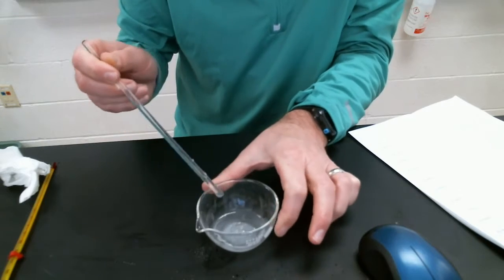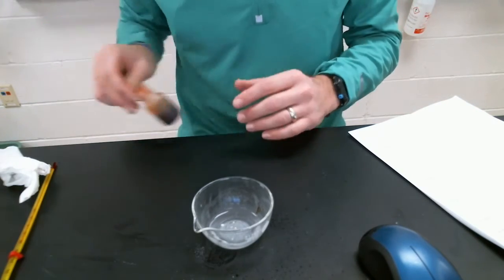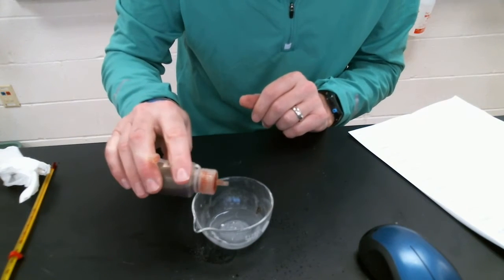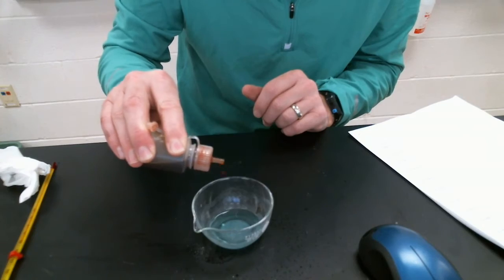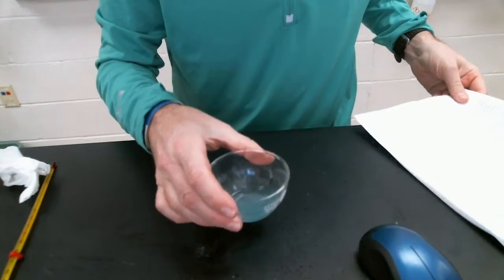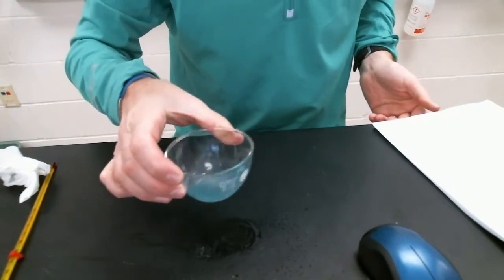And a little bit of universal indicator. Now, we might remember indicators from our days of biology, where an indicator is going to be different colors based on the pH. And this is number 9, by the way. Did some extra drops there just so we could see the color a bit stronger, more clear. And again, we have that lovely greenish tint to it. Again, kind of hard to see with the way the light's working today, but it is a lovely greenish color.